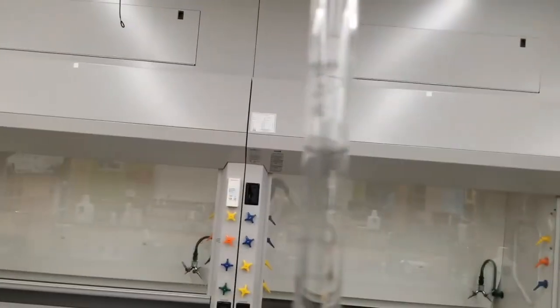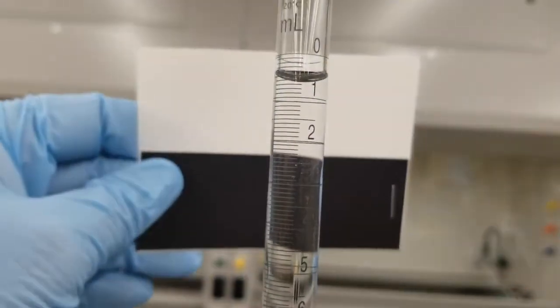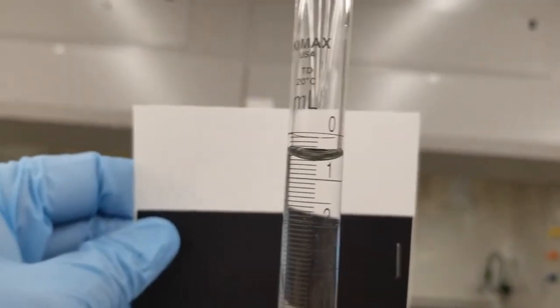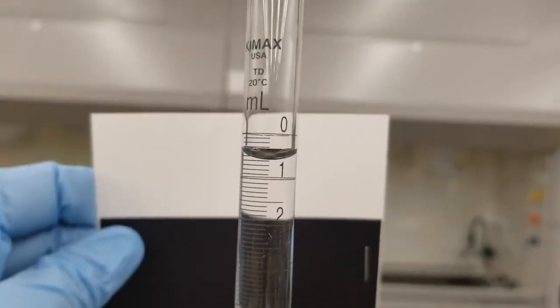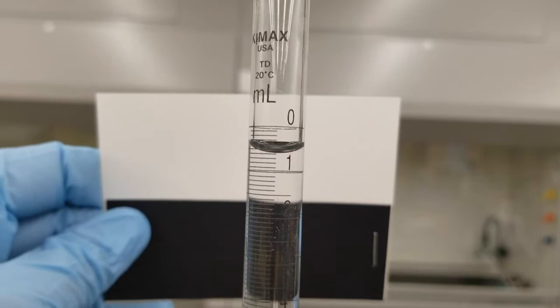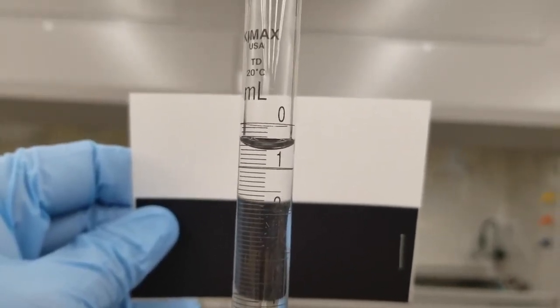milliliters. If you're having trouble seeing that, I can add a card here, and hopefully that white card there might make this a little bit easier to read. So there we go. I'll try and angle that a little bit better. Okay, so now hopefully you should be able to see that a little bit better. You can see why I got that reading as what I did.